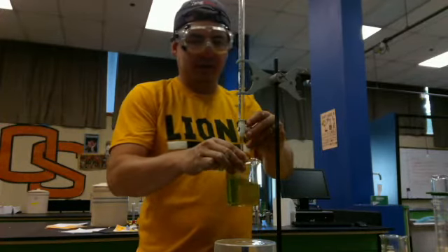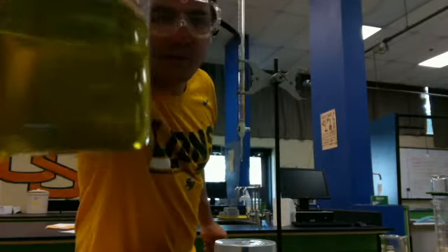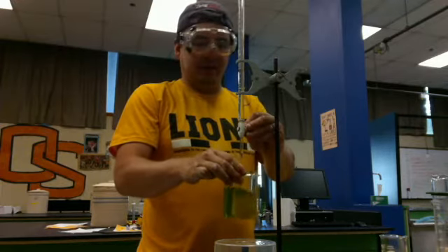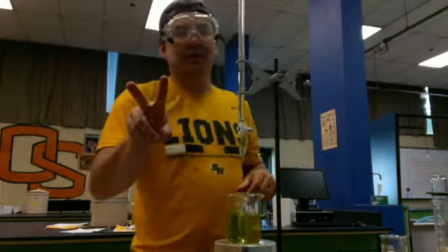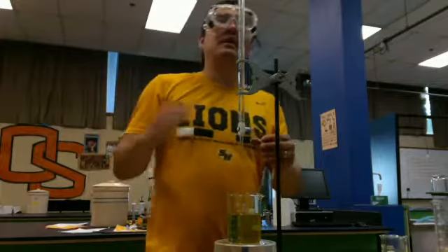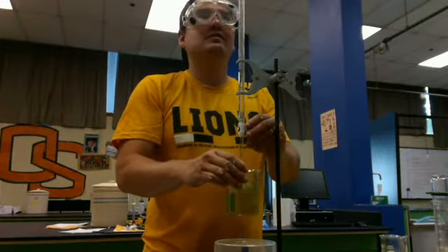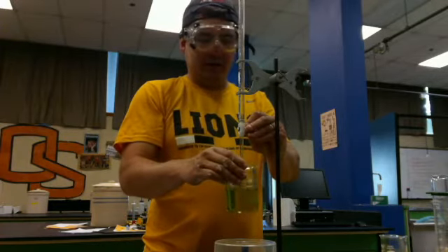This is not super exciting. You can see what's going on. I'm getting more and more, maybe a little change in color. Now, if you guys remember, when you did your small scale titration, it took two milliliters to neutralize your small sample. Well, this sample is 10 times larger. So this should take approximately 20 milliliters. So I've used up so far about 12. I'll slow down when I get close.